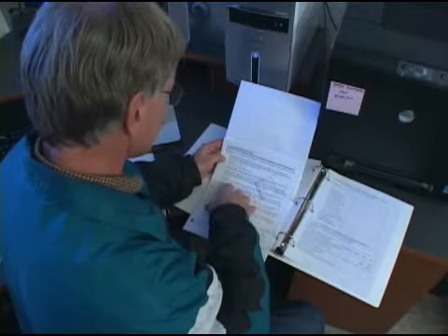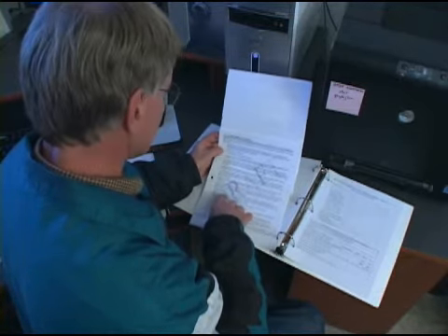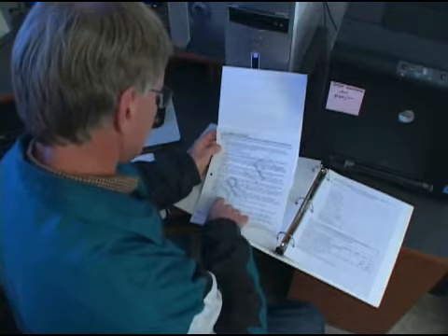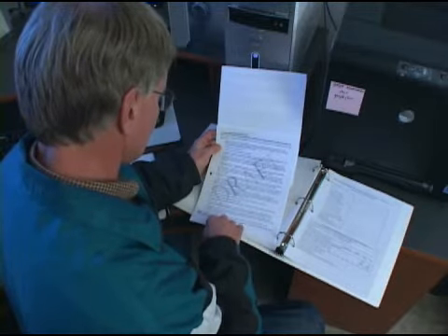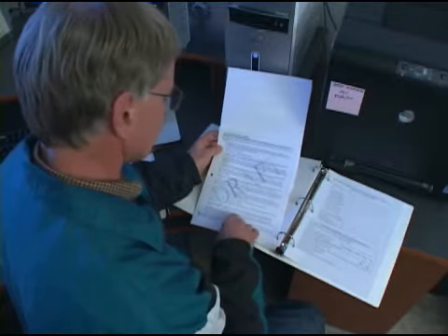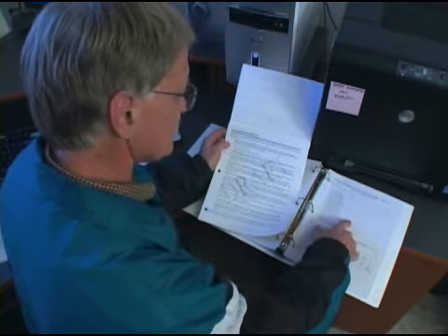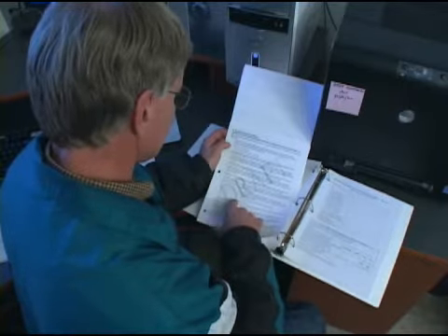There are 2 important documents you will need to read and use throughout this study. They are the protocol and the raw data book. Read through both documents before beginning the field trial. The protocol describes what to do. The raw data book is the place where you will report on what you have done.